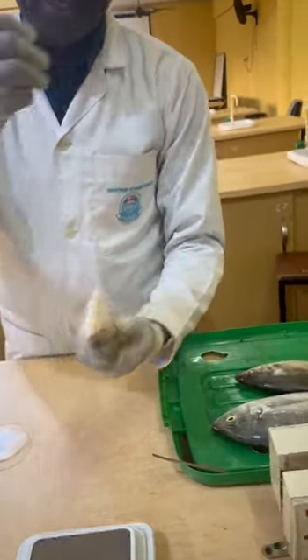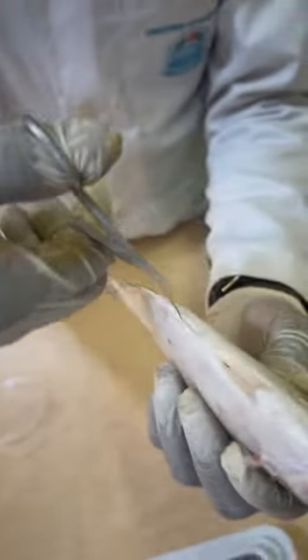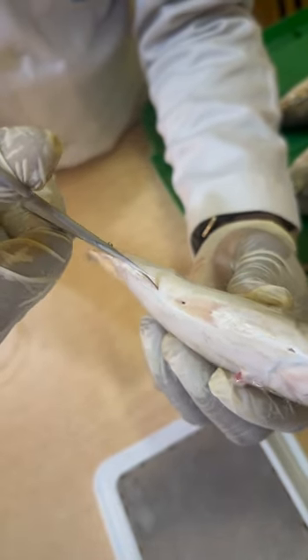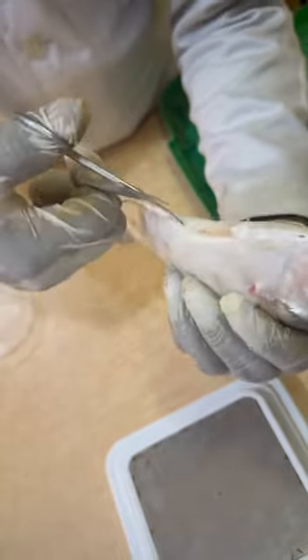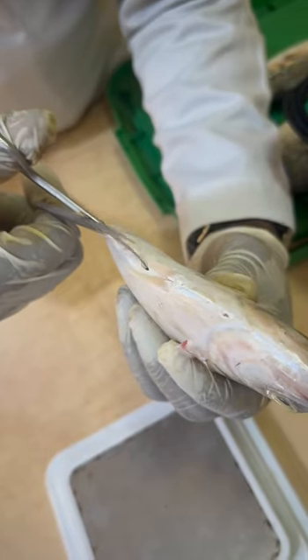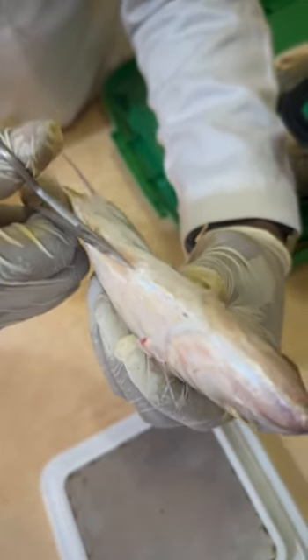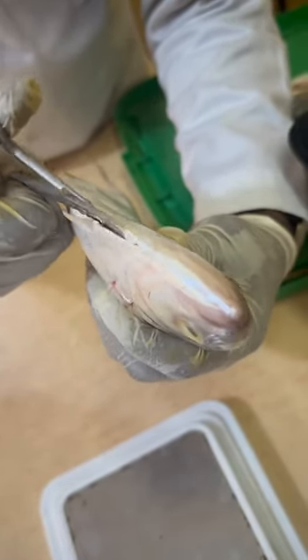We will take our dissecting kit, like I've said the other time, and I removed maybe the scissors. Then I will look for the anal point, and I will insert the scissors. Okay. Oh, sorry. This is the anal point. Okay. So you will now try to cut. Like when women cut clothes. You lift it, you cut. You want to cut it open.